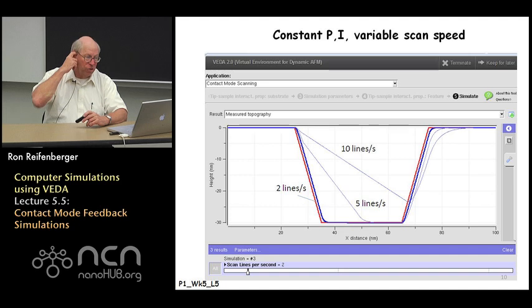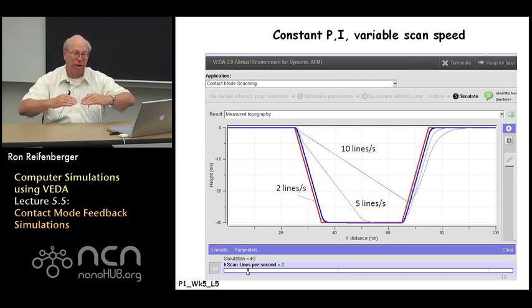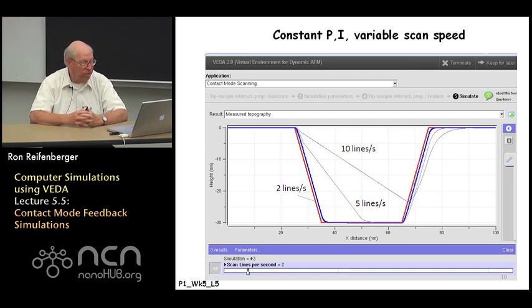So the first slide here just shows, for the constant P and I values that I specified in the previous slide, the motion of the substrate with respect to the tip as a function of scanning speed. So what you can see is that for scanning speeds on the order of 2 lines per second, the AFM tip reasonably well tracks the features in the substrate.